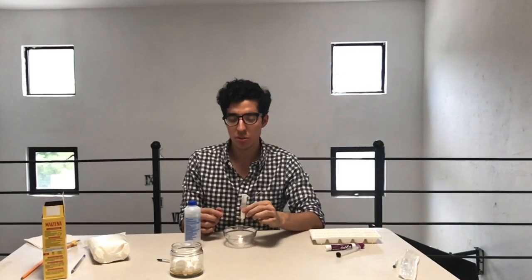Okay, this next step is called activation. The activation is when you put in, for the first time, your mobile phase and let it go through your stationary phase. But this is without the analyte, or the substance that we're going to separate. This will activate the retention activity of our stationary phase. I already did it, so take a look.